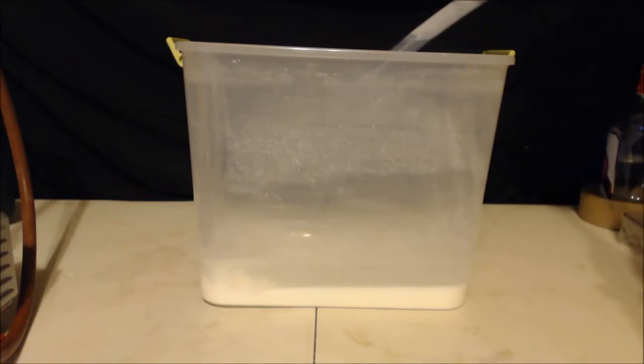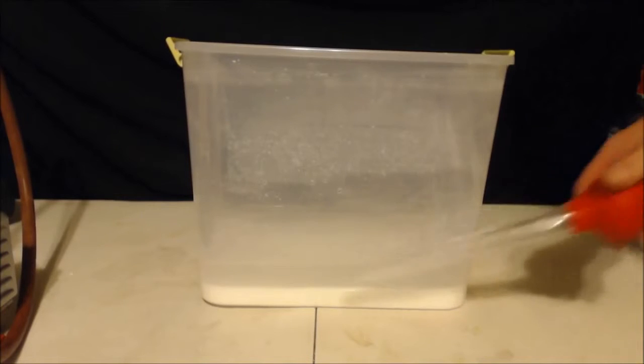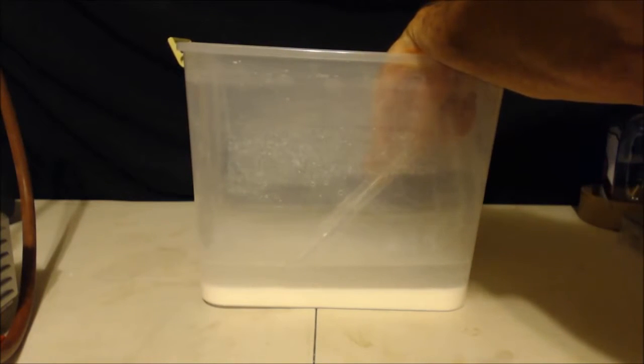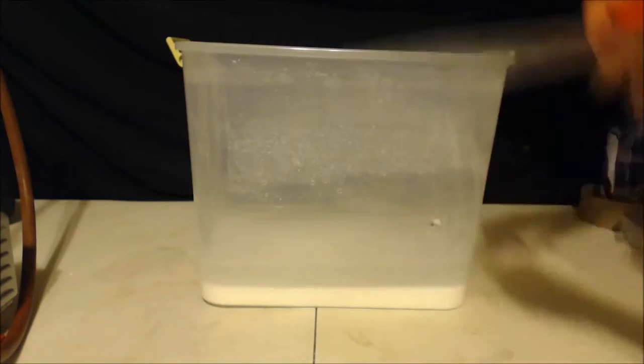We're going to start sucking stuff up. And if you want that little bit that's left there, you can use a turkey baster. Get out a little bit at a time so you get it all the way down.